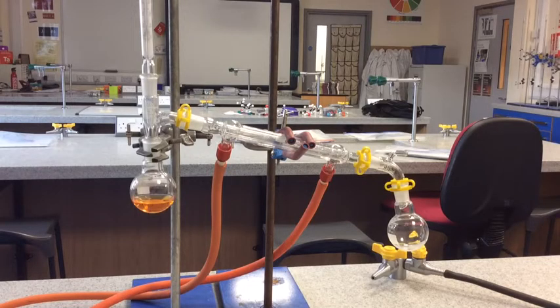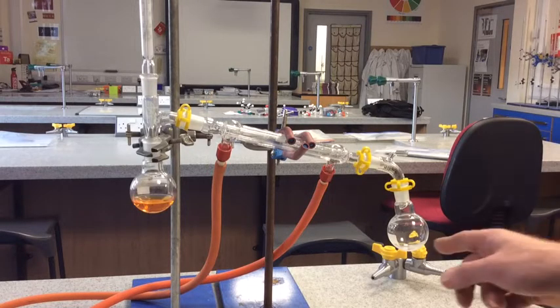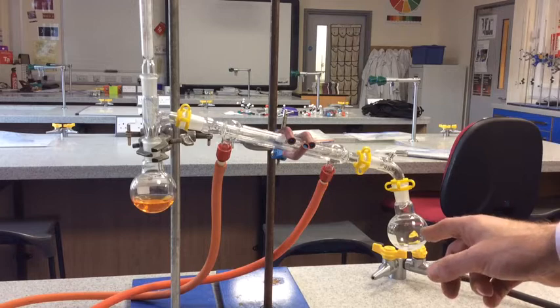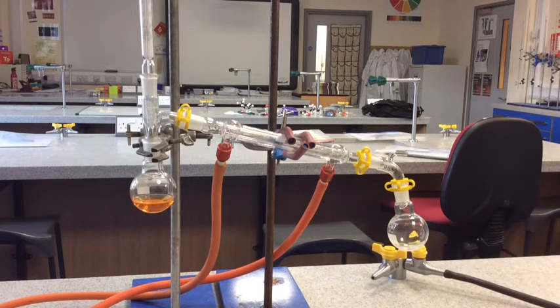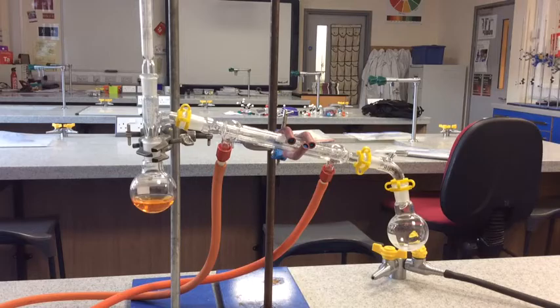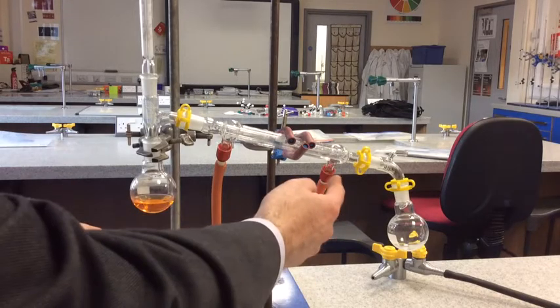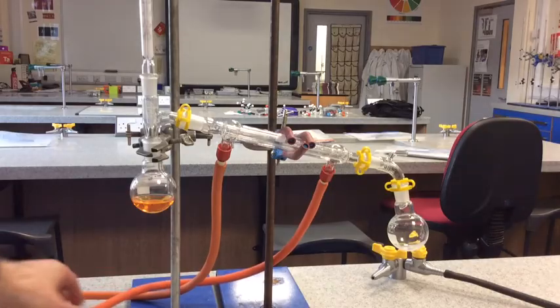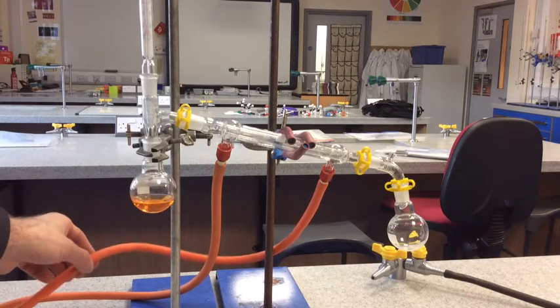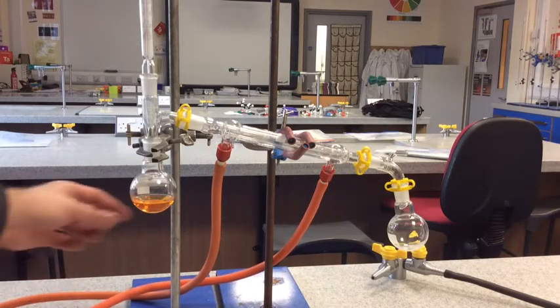The condenser is now in a different position and we have another flask here to receive the product of the reaction. I'll set this away and we'll watch what happens. The first thing I'll do is turn the water on. Again, the water is connected at the bottom of the condenser, so this tube here is going to go to the cold water tap, and this tube here is just in the sink as well to allow the water to flow out.